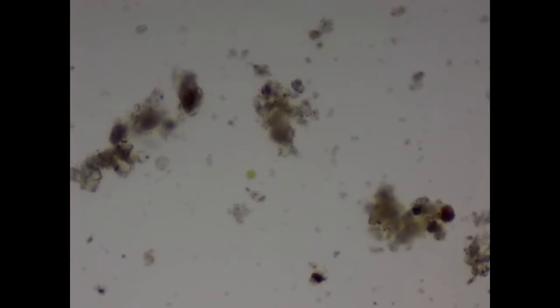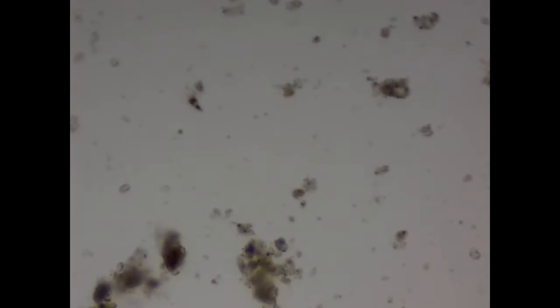Here is some footage from the raw pond water pretty much straight out of the jar. Typically what I saw were these dark brown to light brown sedentary objects, which I presume to be organic materials — most likely just decaying plant material. Nestled within these dark brown splotches could be something like parasitic egg worm nests or mosquito egg nests hiding within these masses. These could be anything from amoebas to paramecium to daphnia to algae, and I just attempted to visualize anything that was really moving.